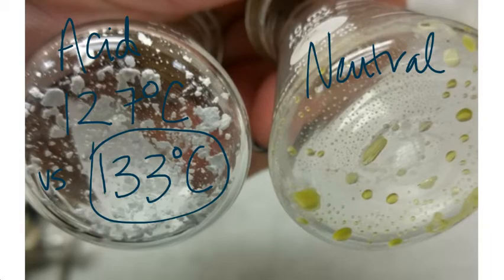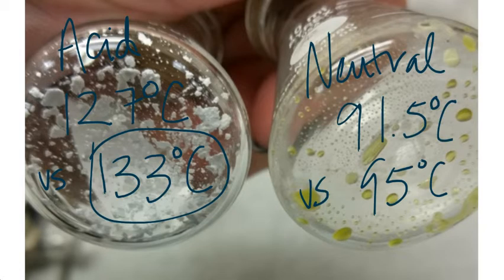For the neutral, we had an average of 91.5 degrees Celsius, and we compared that to the known average of benzil, which was 95 degrees Celsius. Again, it was a safe bet to assume that our neutral was benzil. And when checked with the professor, these were both correct.